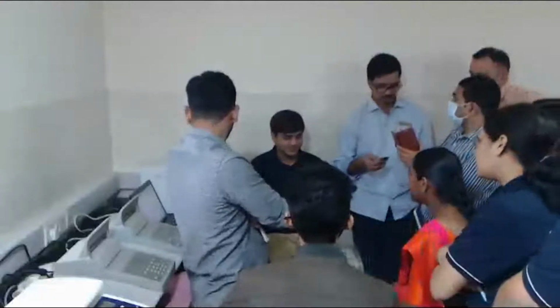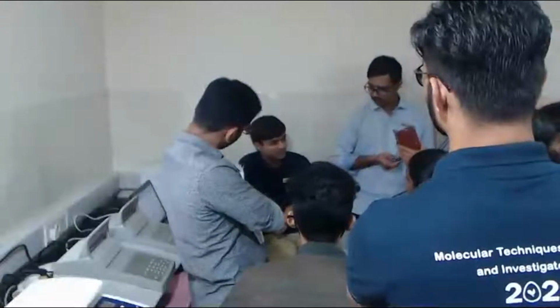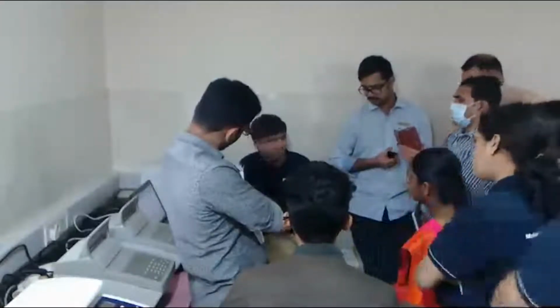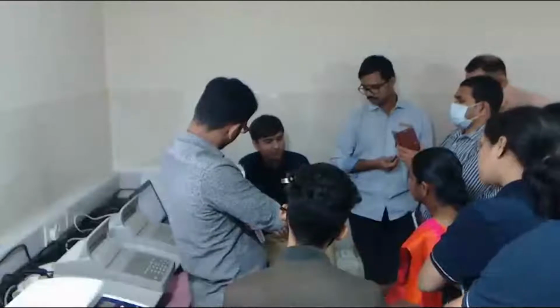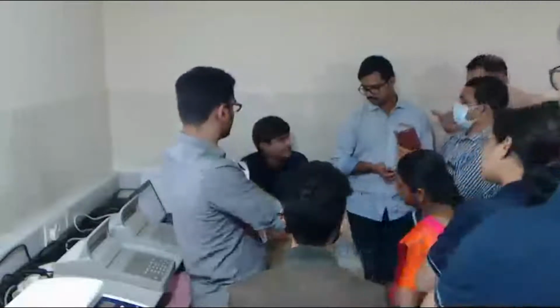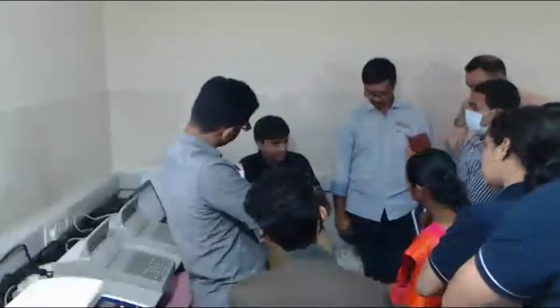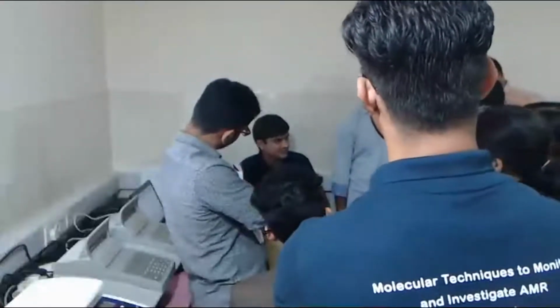So for 16S metagenomics, we have a final library size of around 630 base pair. In case of the AMR panel of AmpliSeq, we have a library size ranging from around 175 or 200 bases to almost 500 or 600 bases. So for both AmpliSeq as well as 16S metagenomics, we use DNA 1000.